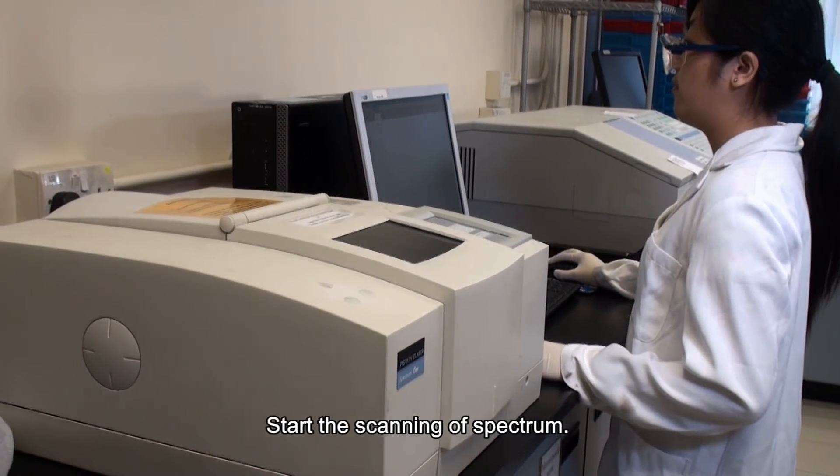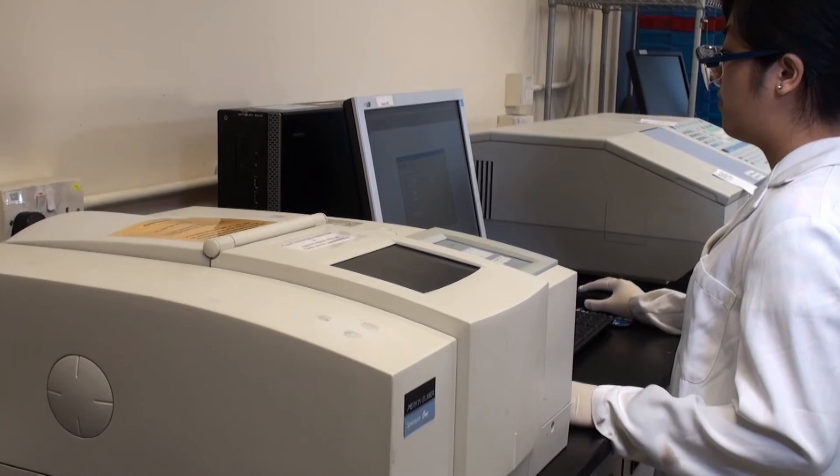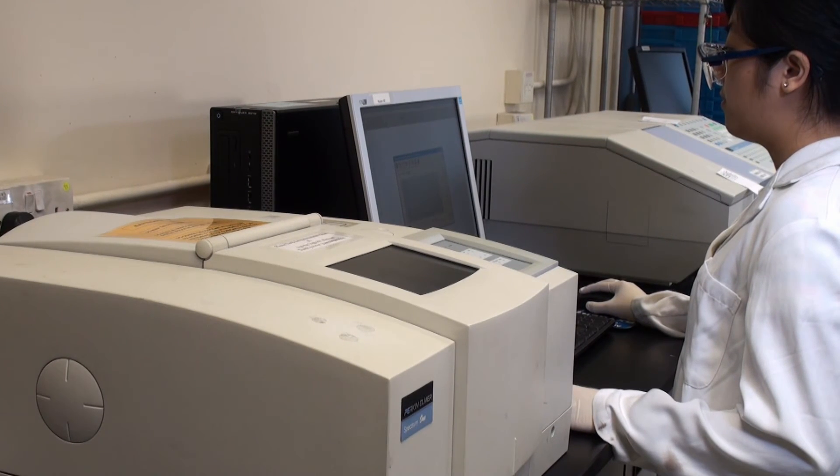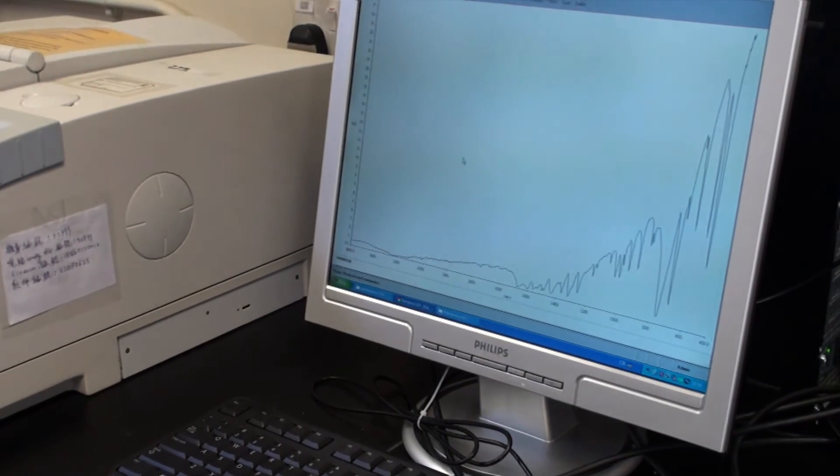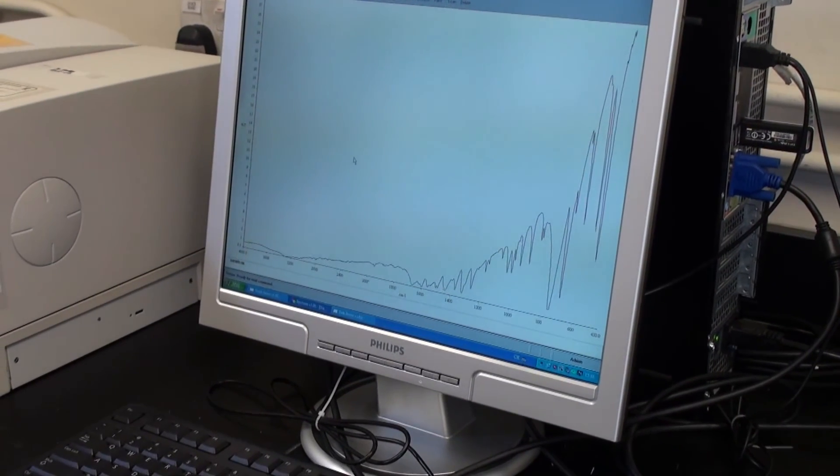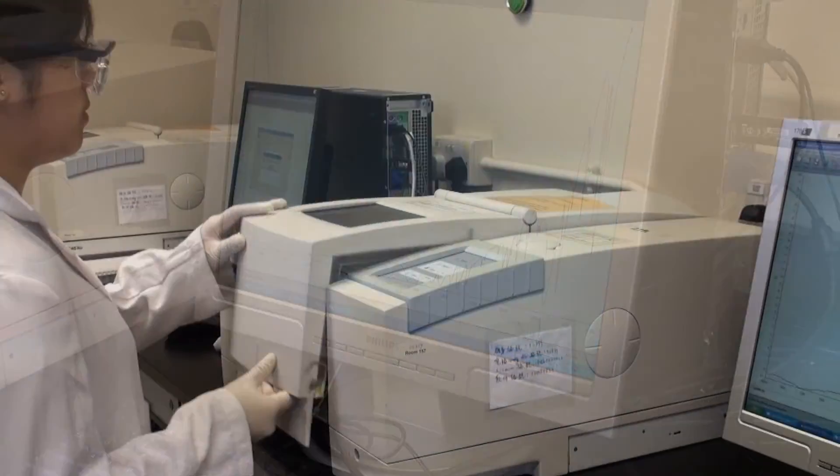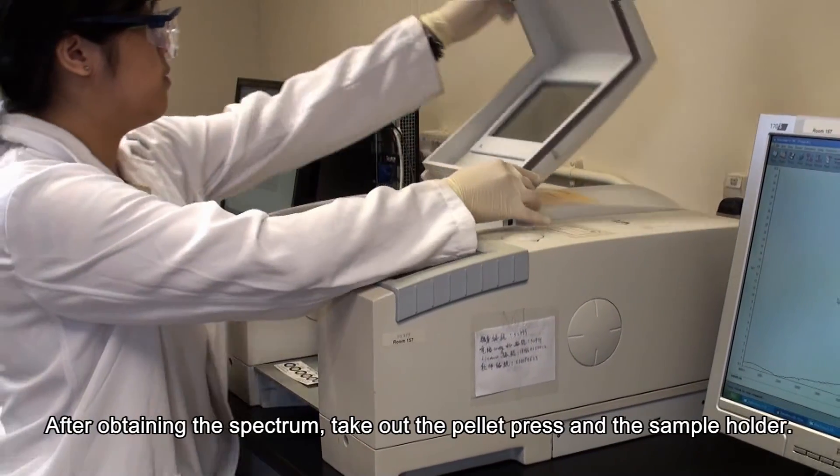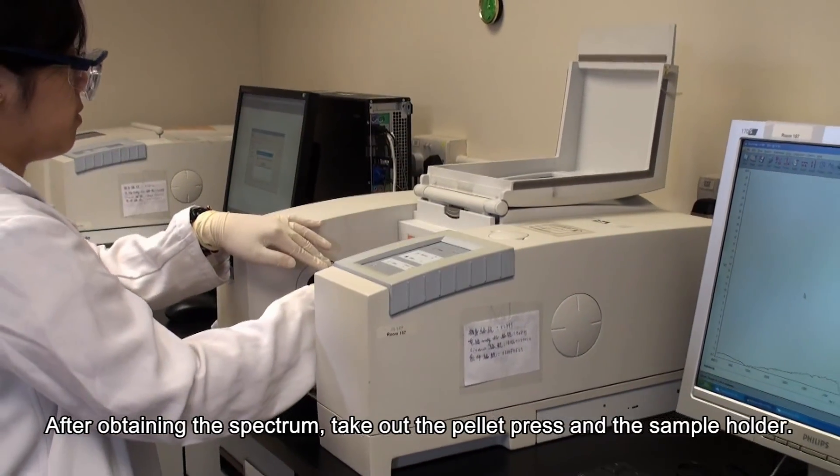Start the scanning of spectrum. After obtaining the spectrum, take out the pellet press and the sample holder.